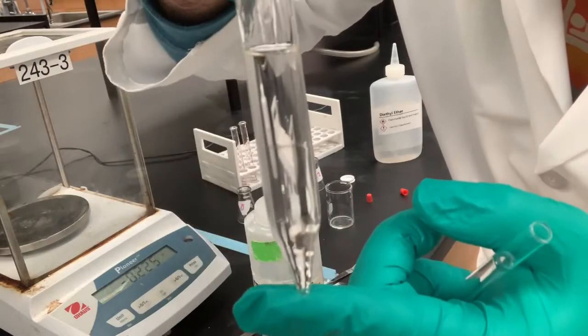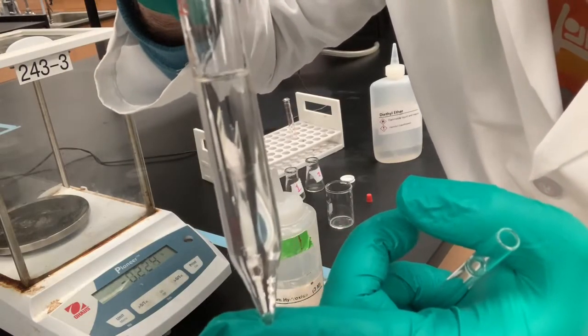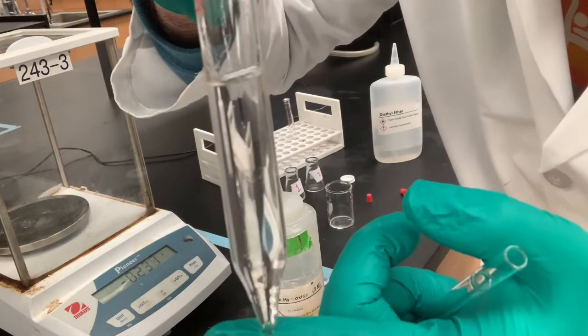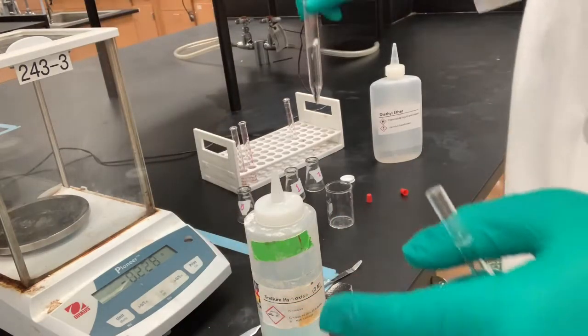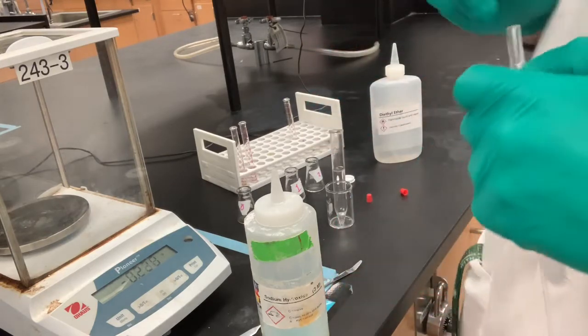Normally, I would do this with a flashlight if it is hard to tell, and I would be more easily able to see the separation. But for right now, this should be good enough for our needs. So step 5 says to let it separate, and they did.